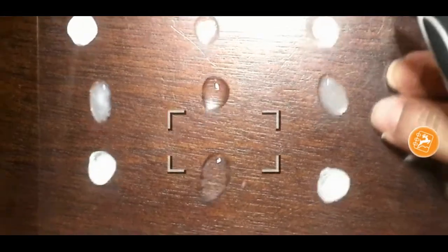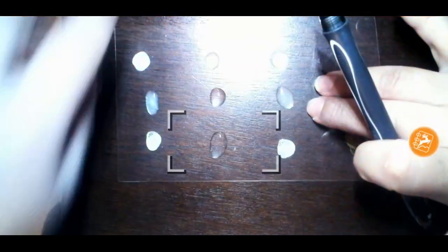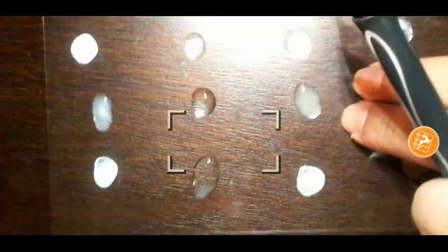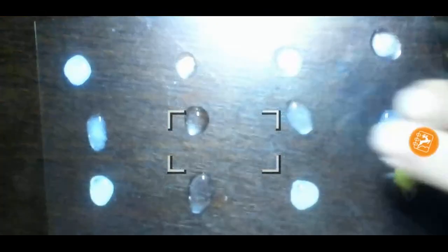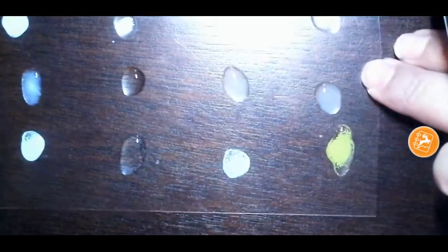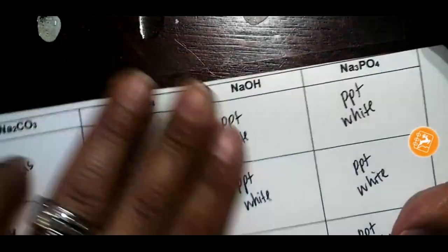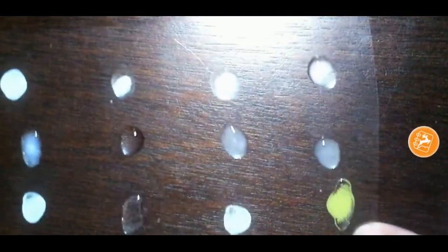So you can go ahead and give a third descriptive term for these three. If you need to see it again, I'm going to zoom in. And then now we're on the last column. So now we're looking at these three. And I want you to go ahead and add a third term.